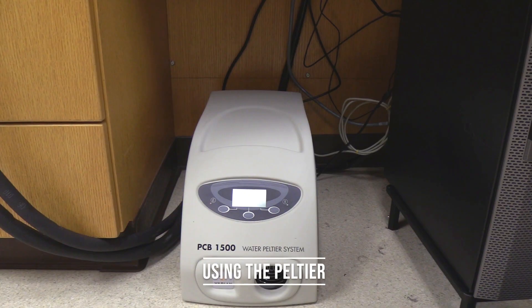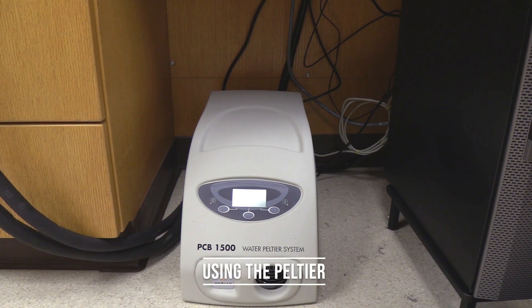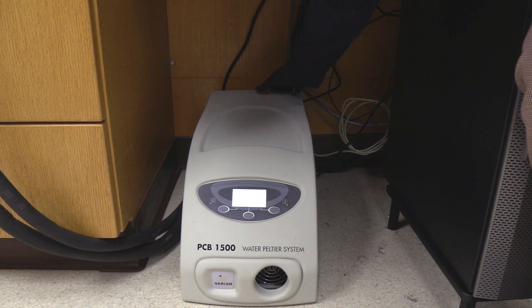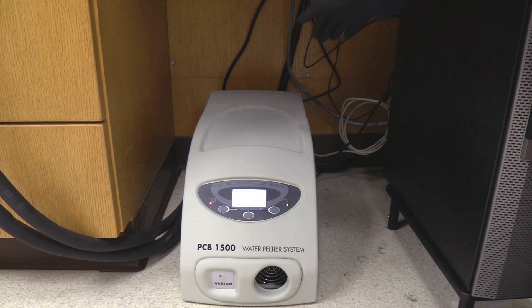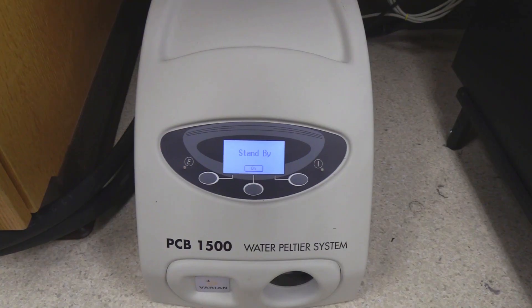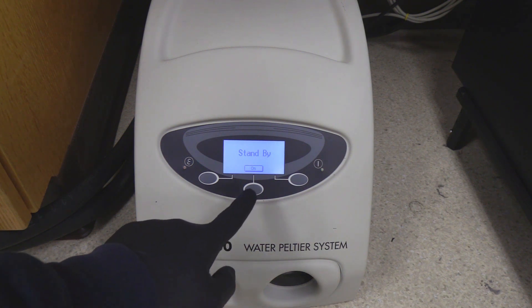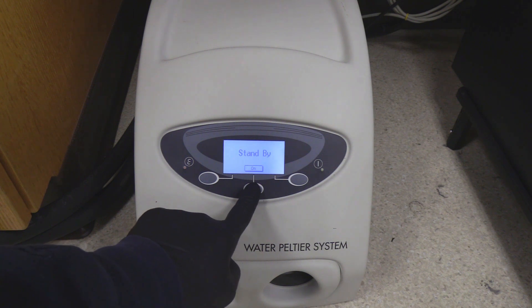Using the Peltier: if temperature control is needed, the operator will need to turn on the Peltier system and set the desired temperature. First, flip the power switch located on the rear left corner of the Peltier system. The display should turn on and the system should be in standby mode.